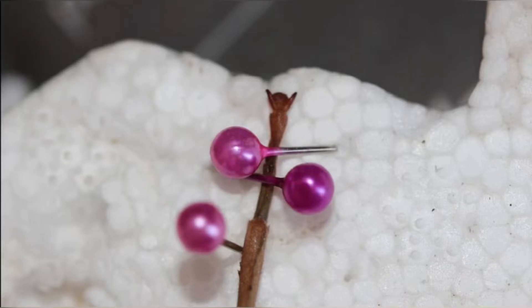If the tarsae and tarsal claws are not keeping their position by themselves, you can also cross two pins over the tarsal segments.